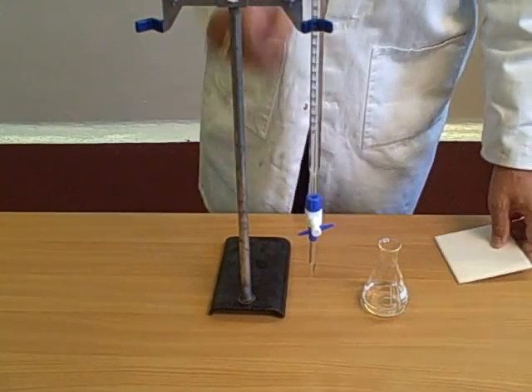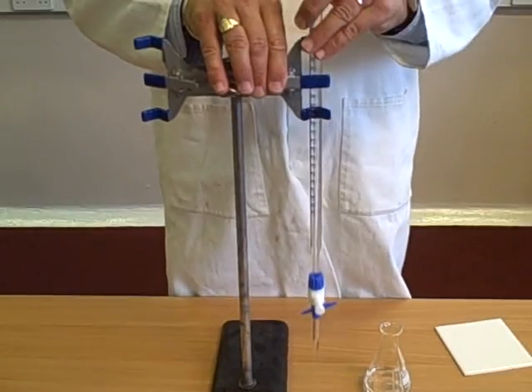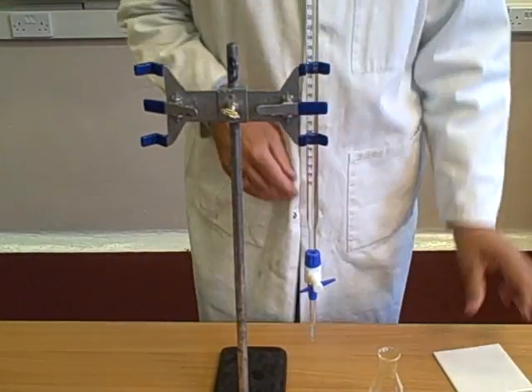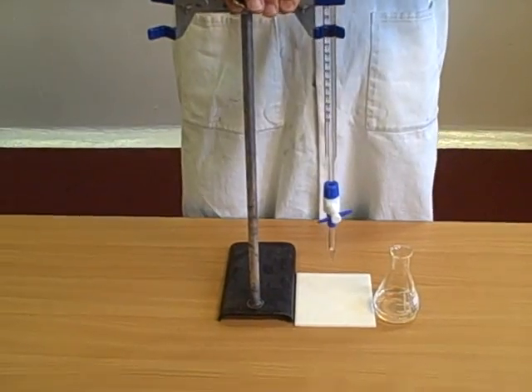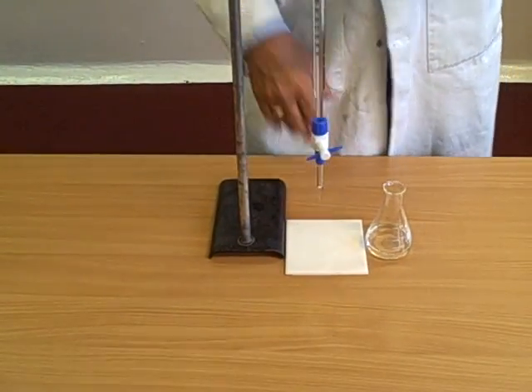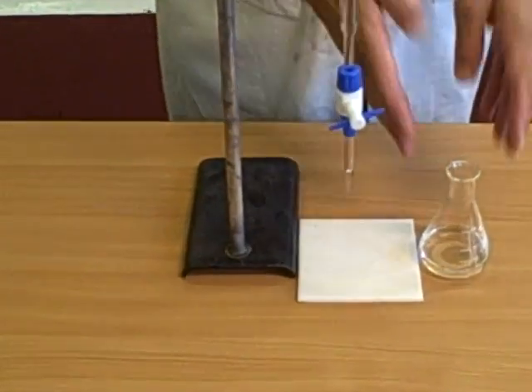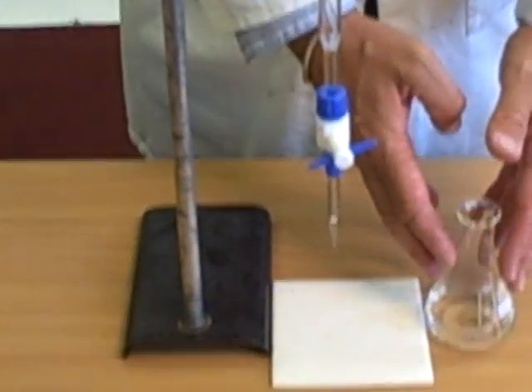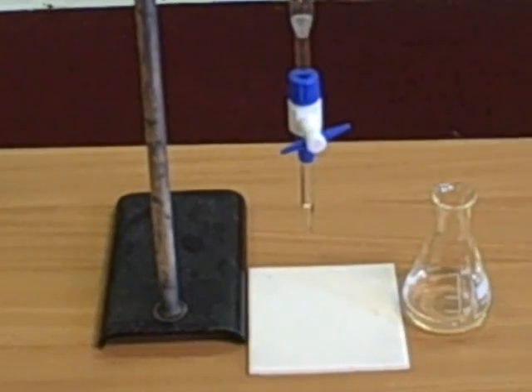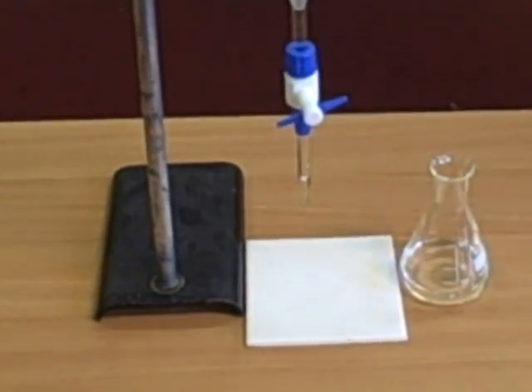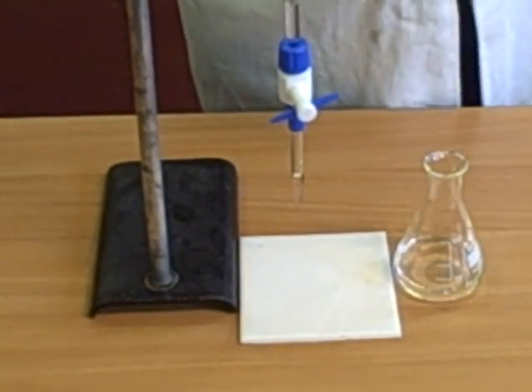I have, in here, 50 mils of acid. We're now going to mix the two. There will be a chemical reaction. You may know what is formed by the reaction of an acid, and sodium hydroxide is an alkali.